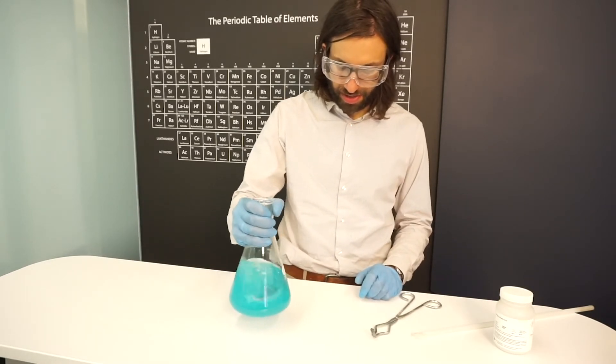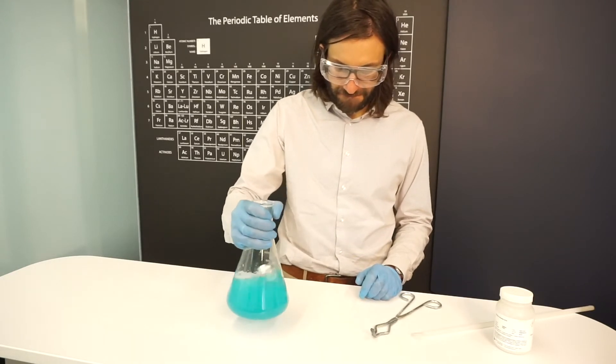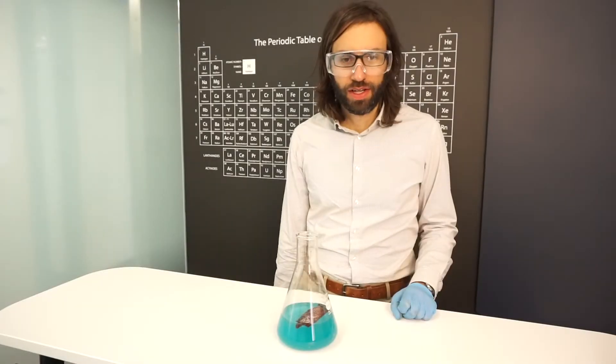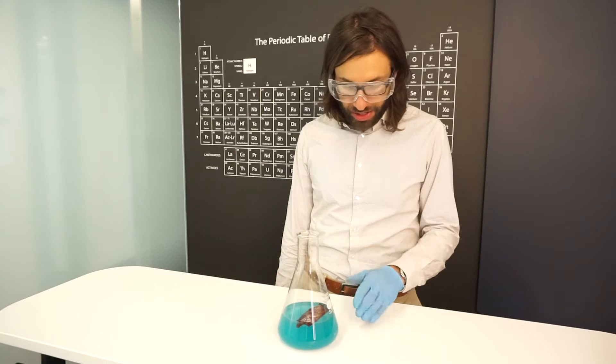Now we're going to swirl this together. So now we've waited just a few minutes, and you can see a clear reaction has taken place.